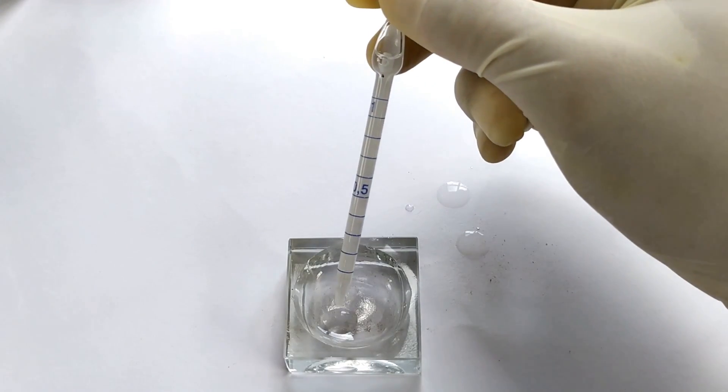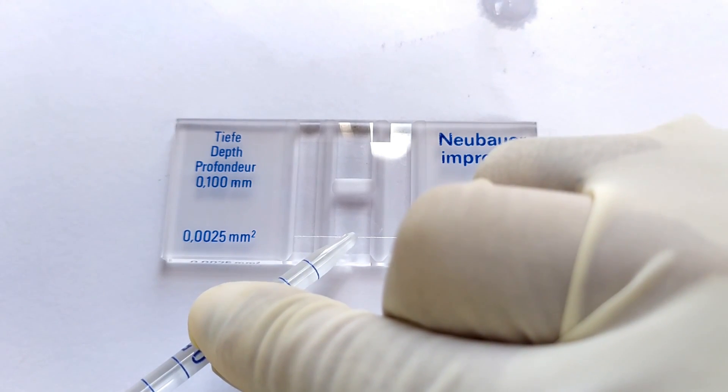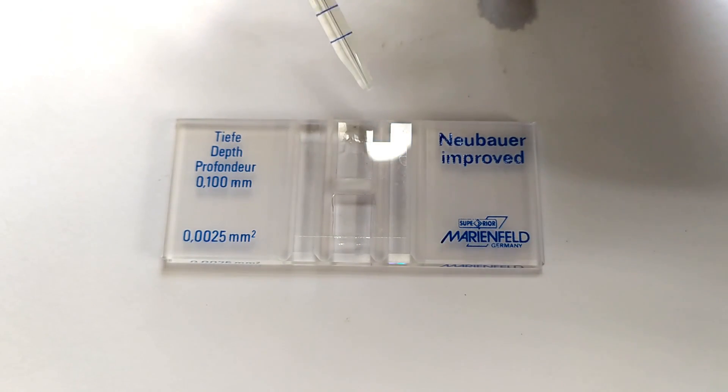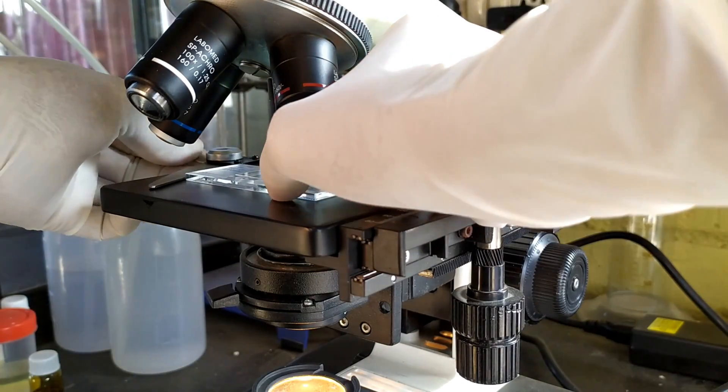Discard the first two to three drops from the pipette, then load the counting chamber with the diluted semen sample. Place the loaded chamber under the microscope and let it rest for a minute or so. Under 40x objective, begin counting the sperm cells within the four corners and the central small squares of the central large square. Remember to apply the thumb rule of cell counting by excluding cells found along the bottom and left borders of the squares.